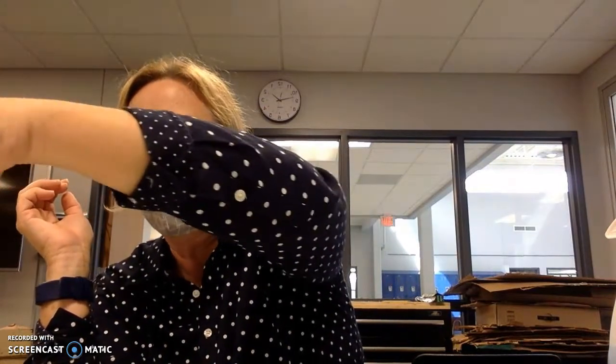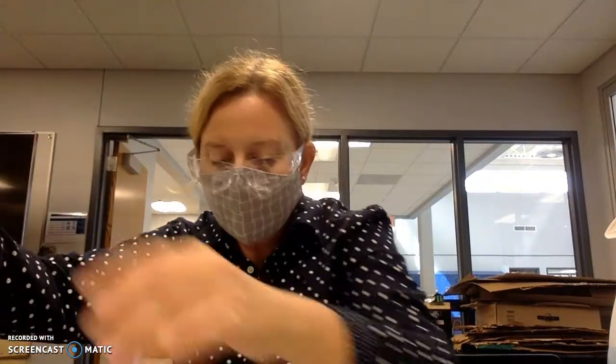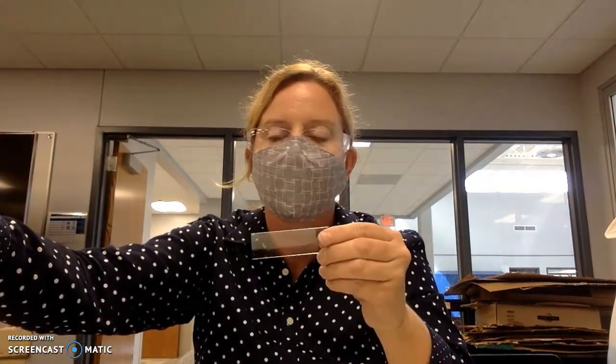So the heat from the water is allowing the phenyl salicylate, the crystals that make it up, to melt. And so remember, there are 3 different cooling methods that we are experimenting with. We have ice that we place in a petri dish. We have hot water, set a slide over hot water, and then just simply room temperature. These are microscope slides, and we just set it down on the paper towels on the tray.